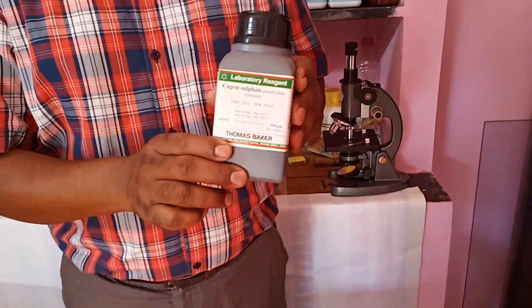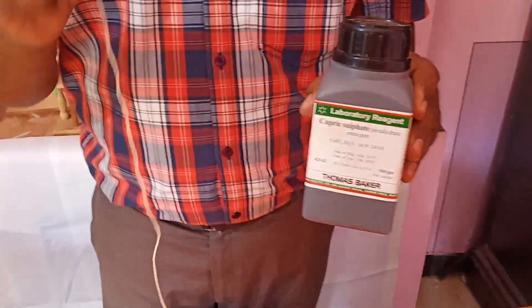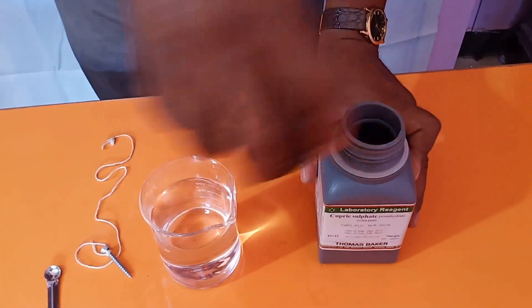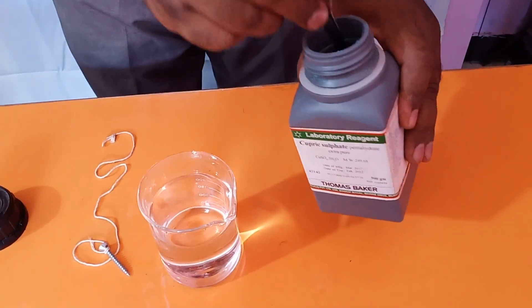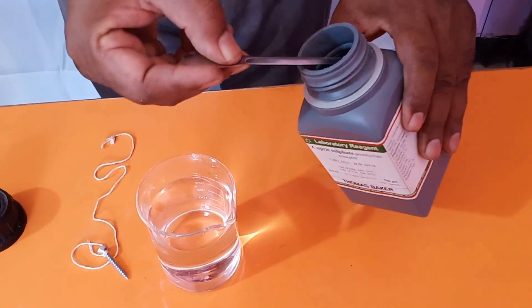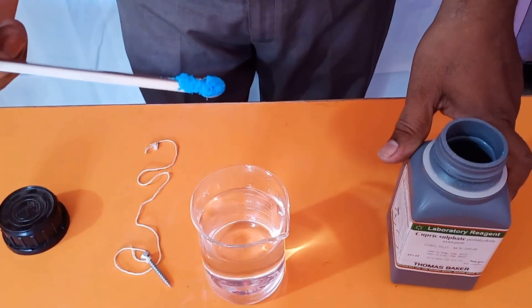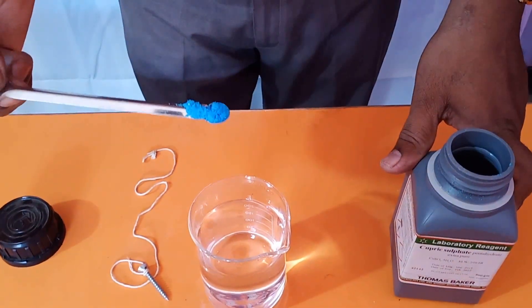In this displacement reaction I have taken copper sulphate and iron. Now what I am going to do is prepare the aqueous solution of this copper sulphate. These copper sulphate crystals — see the color, it is very shining blue. Remember this color.